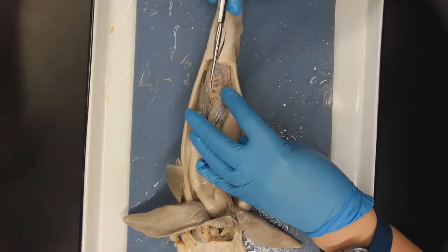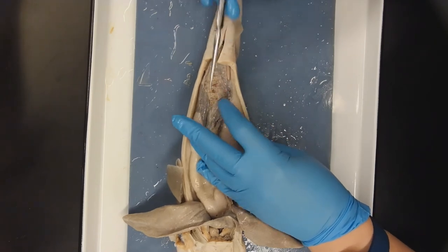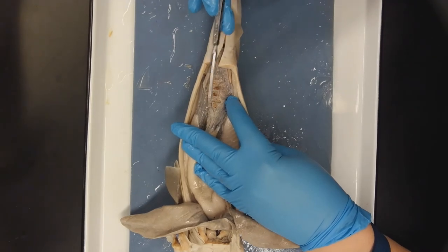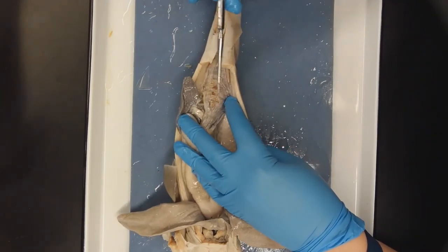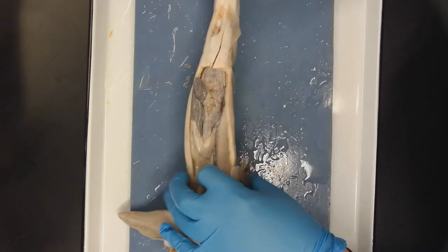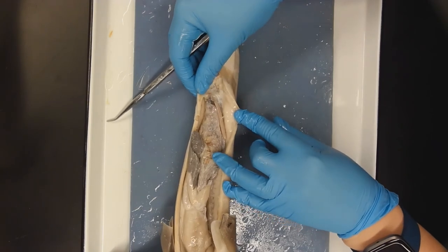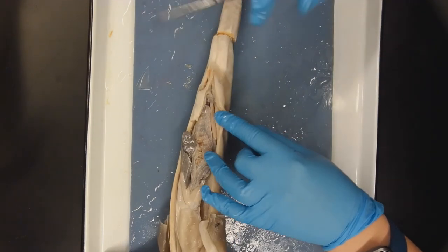Since the dogfish shark has a fairly short and rather primitive digestive tract, it's important to have more specialized structures like the spiral valve to increase the functionality of the system. Now finally below the spiral valve, which isn't too obvious in this animal, is the rectal gland, which helps to concentrate excess salts and waste for excretion.